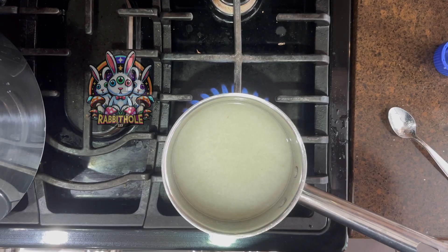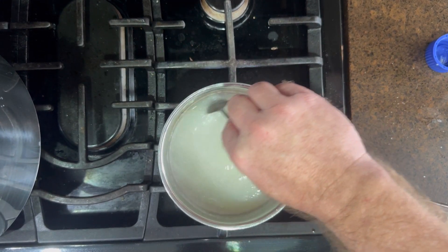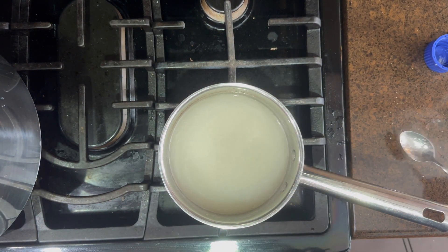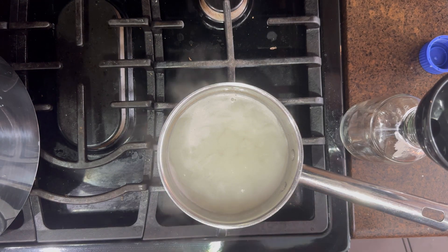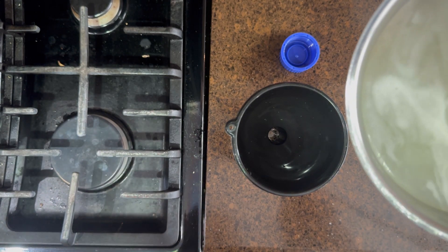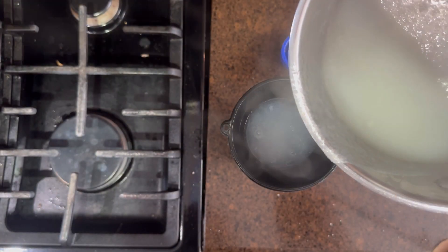For the water you don't have to use anything special. I was checking with my hand to make sure I wasn't melting my camera as I'm warming this up — it's pretty hot up there, so be very careful with the heat. Keep stirring it, because that light corn syrup will try to caramelize if you don't take care of it. I had a little bit caramelize but you don't really see it. Pour it into your jar — I'm using a bottle but you can use a standard jar.